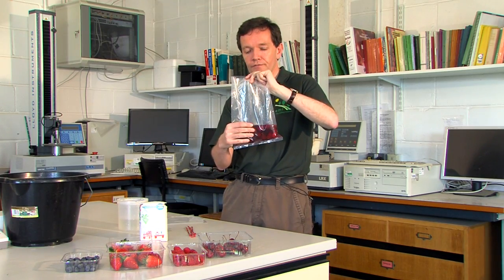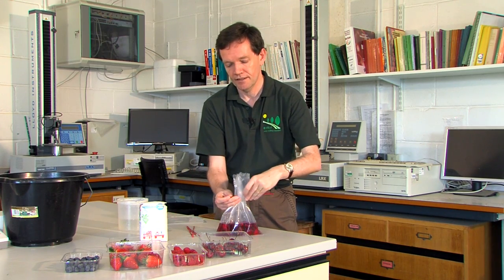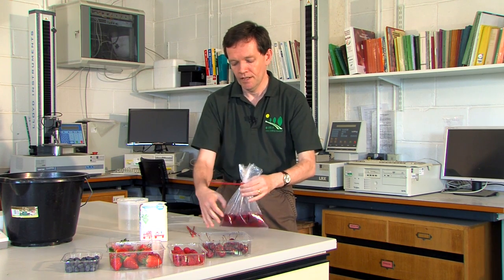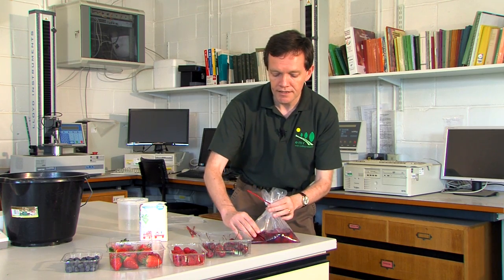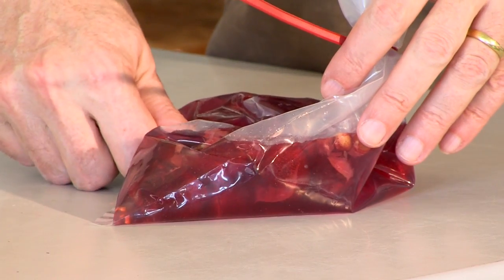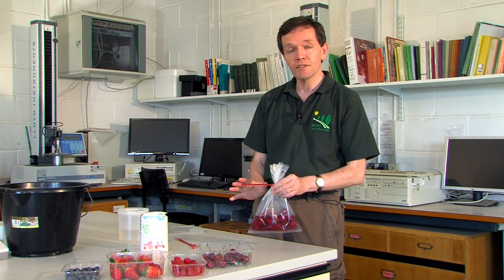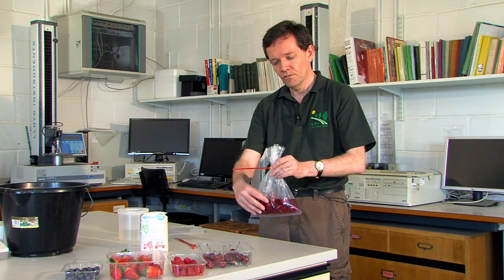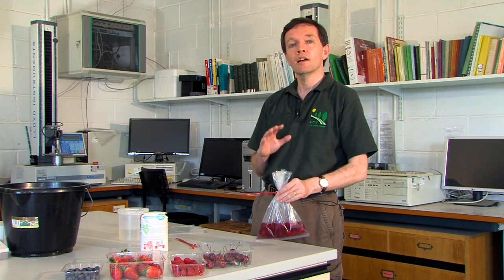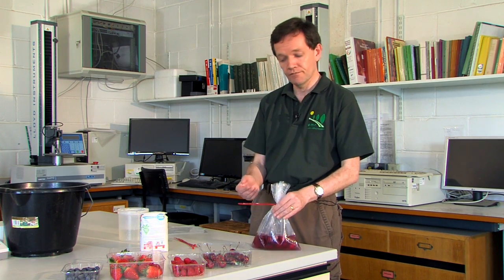Break up the fruit and then seal the bag with a cable tie. At this point if you want to compress the fruit a little more, you can press it on the bench. Wait about 10 minutes, come back, just mix everything up a little more, come back after another 10 minutes and you should see larvae if they're present in the solution.